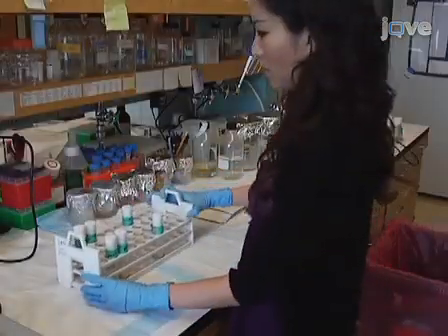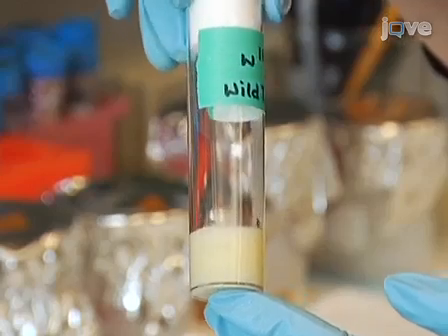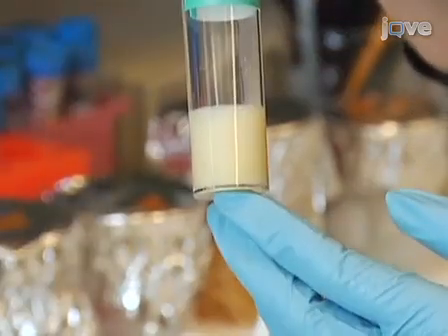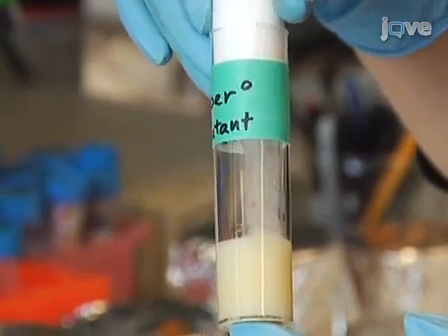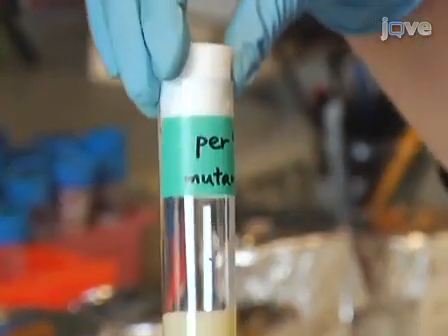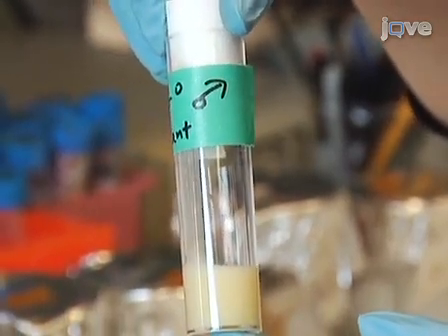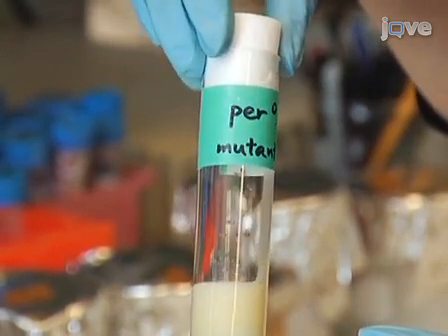It is crucial to assess these phenotypes using proper control animals that are reared in the same environmental conditions and of the same age. In addition, there is sexual dimorphism in circadian rhythmicity. The general practice is to use adult male flies for these assays that are reared at 25 degrees Celsius and between 1 to 5 days old, because egg-laying activity in female flies will affect true measurement of locomotor activity.